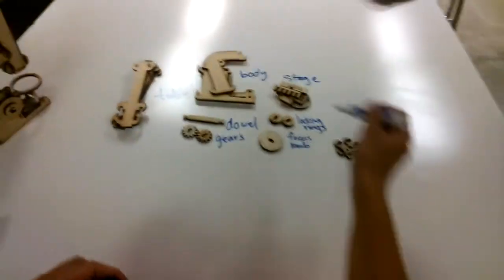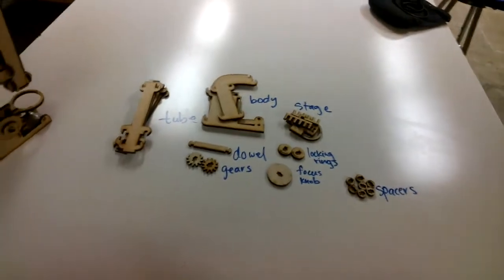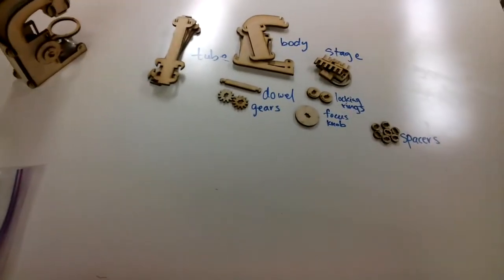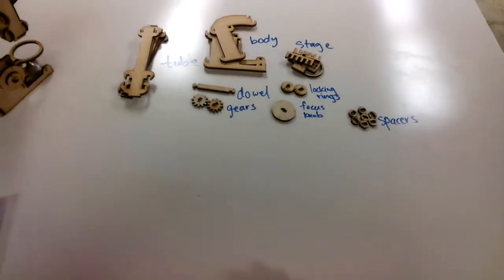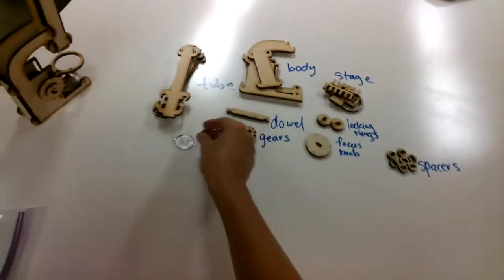Okay, so these are all the parts you should have in your kit. If you're missing any of them, please let Ms. Nawas or myself or Mr. Fonstedt know. Then you're going to also need to get a few more pieces. These will probably be up in the front of the classroom. So the first thing is a little mirror that you're going to need.